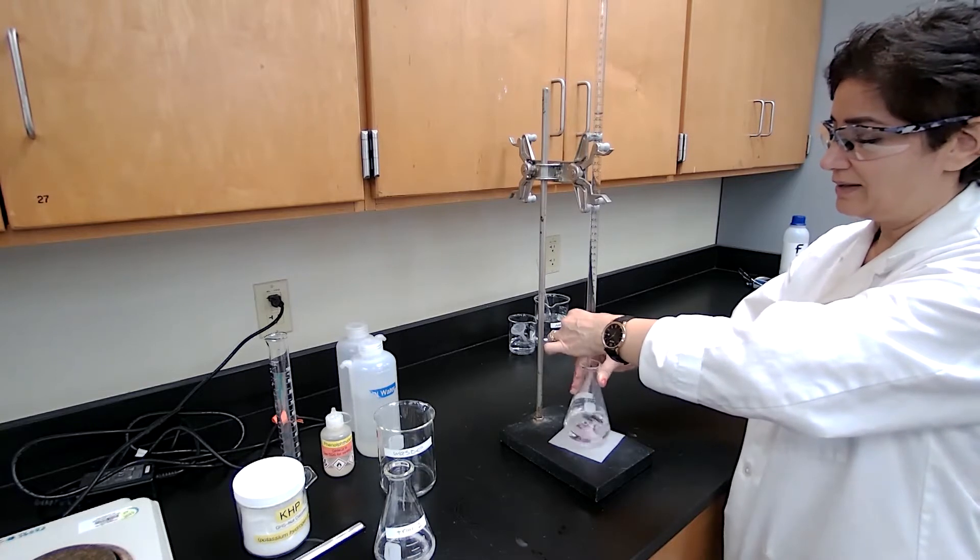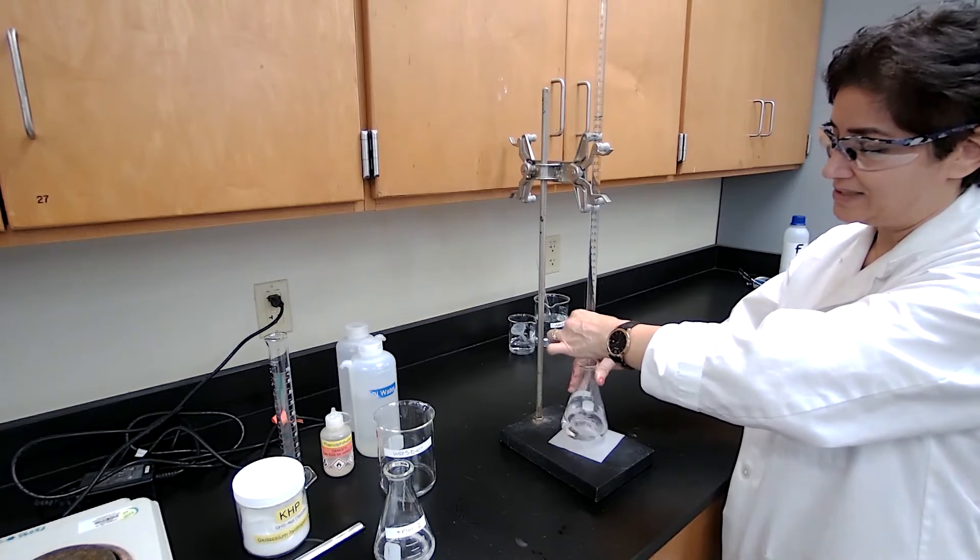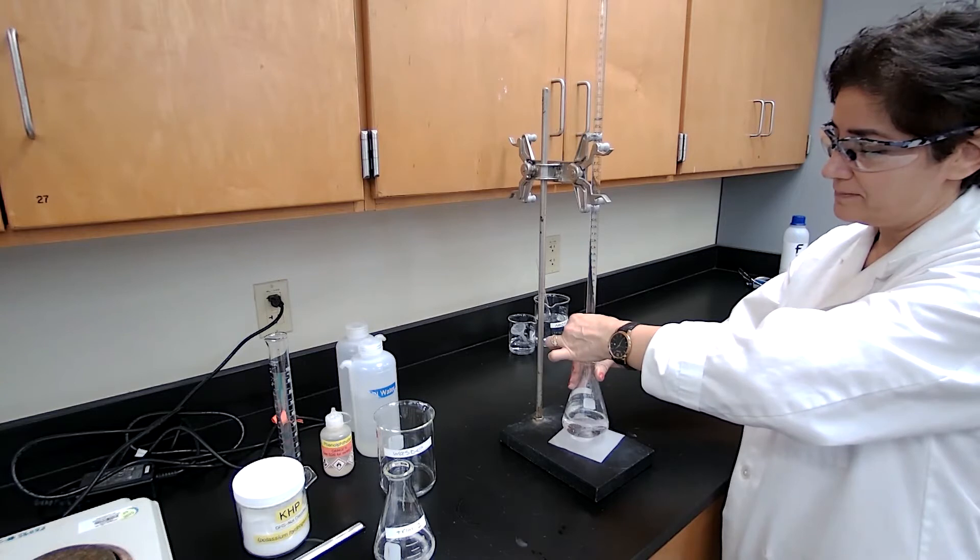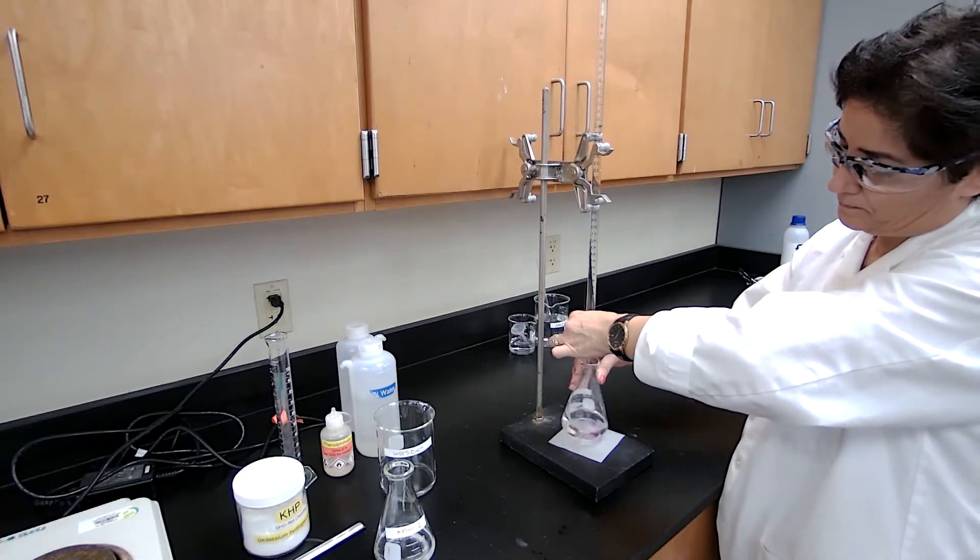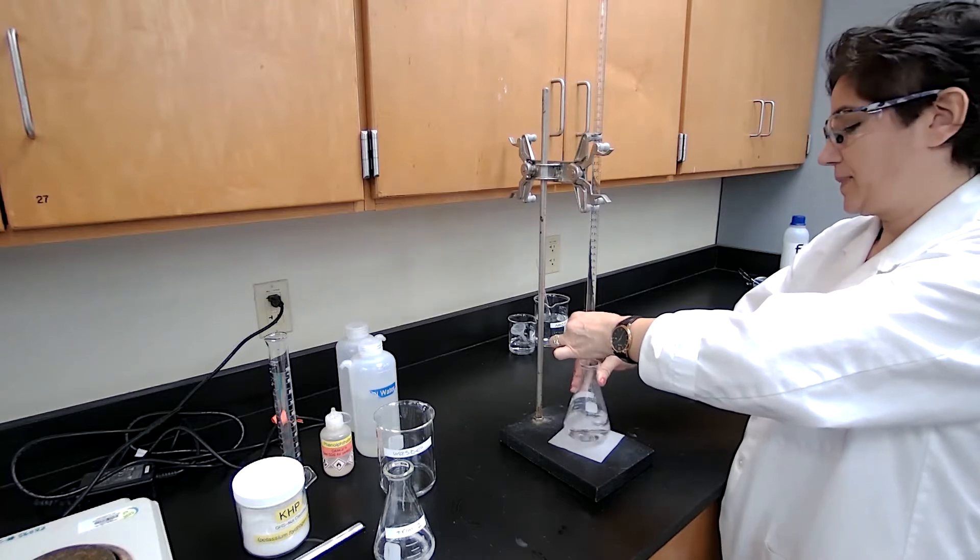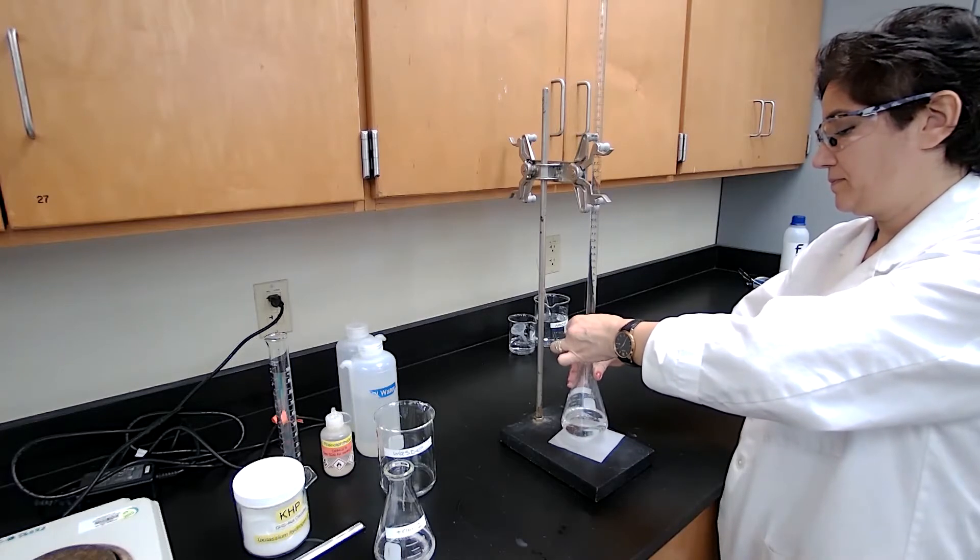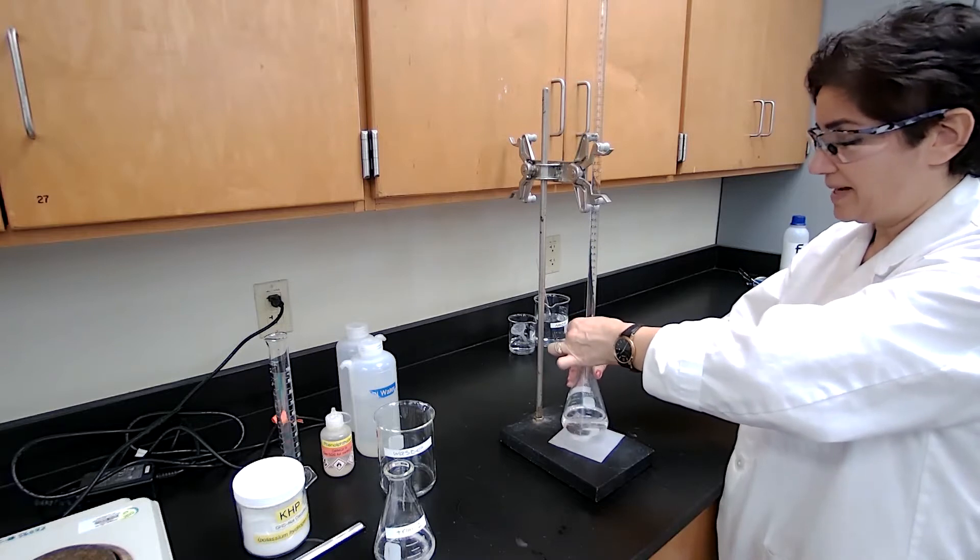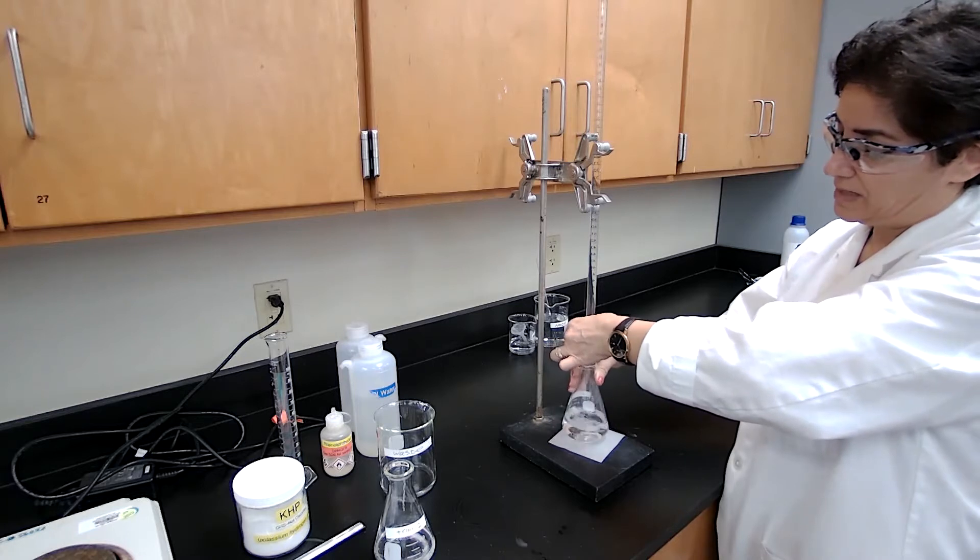But if the first two trials does the job, we don't have to go for the third trial. That is going to save you and me time. Just adding one drop at a time now. And stopping.